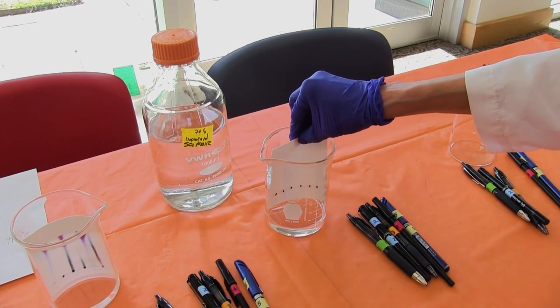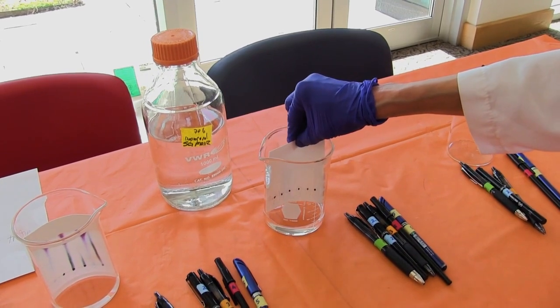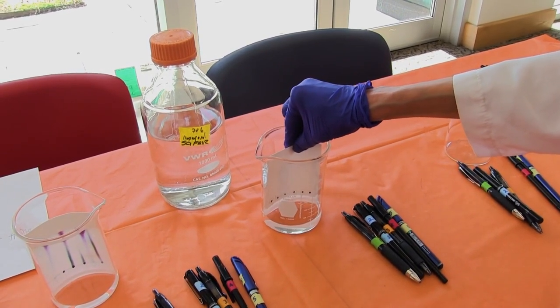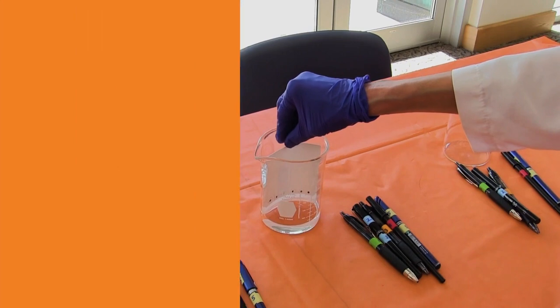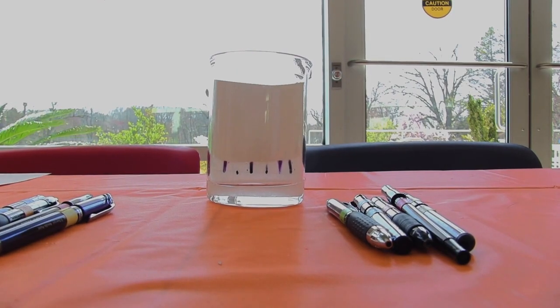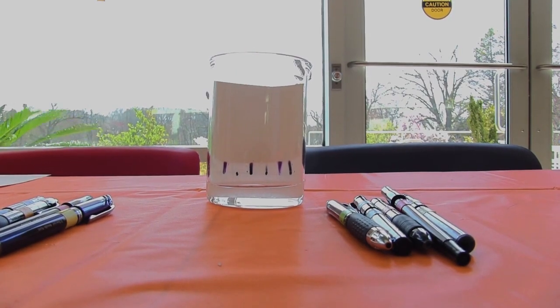Then we're going to use the results from these two methods — the microscopy and the chromatography — to see if we can figure out who the culprit was who stole the birthday cake.